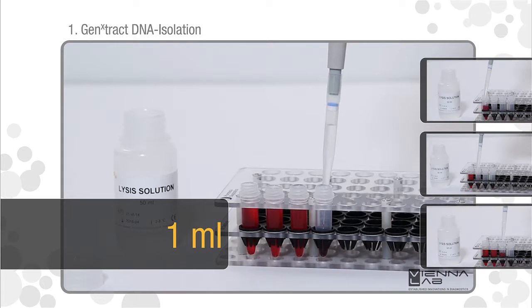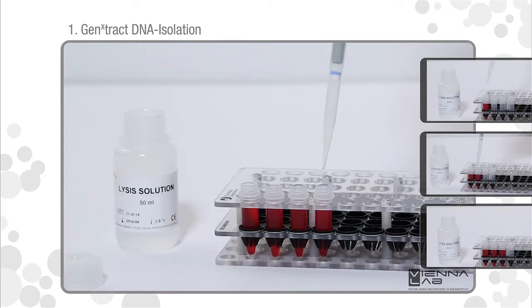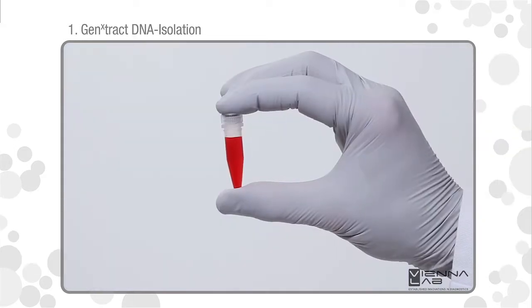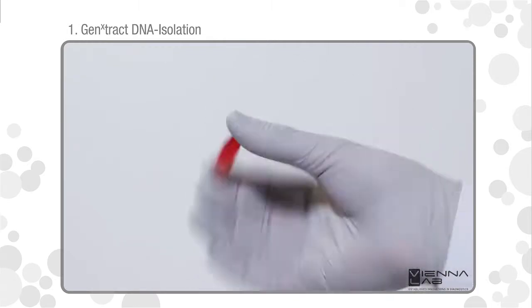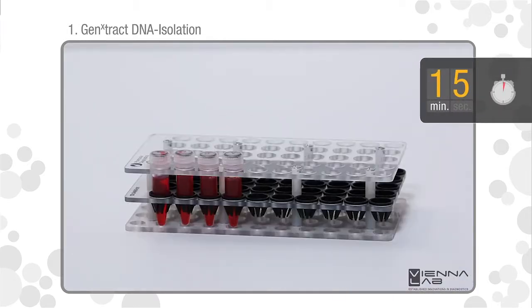Add 1 milliliter lysis solution, close tube and mix by inverting several times. Let stand for 15 minutes at room temperature.